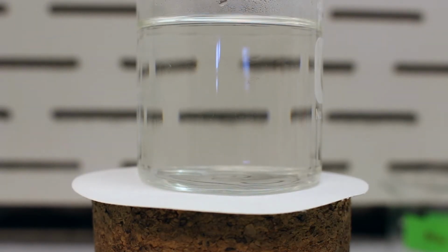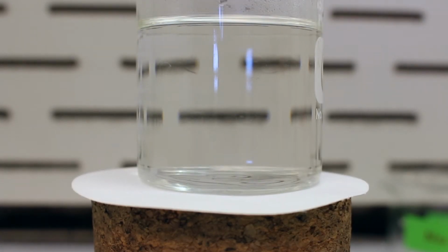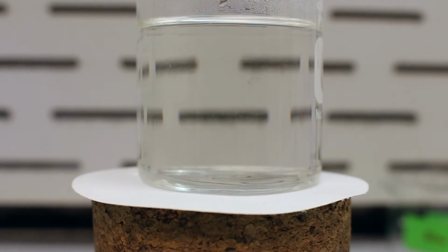Alright, so we've taken the beaker off the hot plate and placed it on this stack of cork rings. I don't know if you can see it below here. It's just to let it cool very slowly. We don't want to chill it or put it in the fridge; we just want the crystals to form naturally and slowly. So please enjoy the next time lapse of the crystal formation. I think you will find it very beautiful.